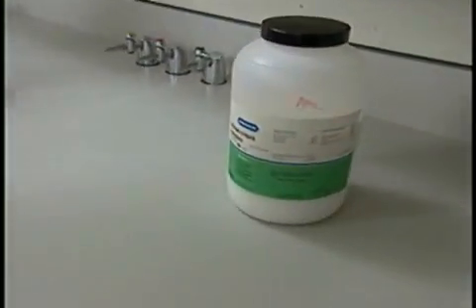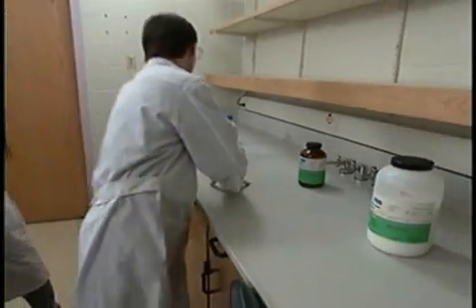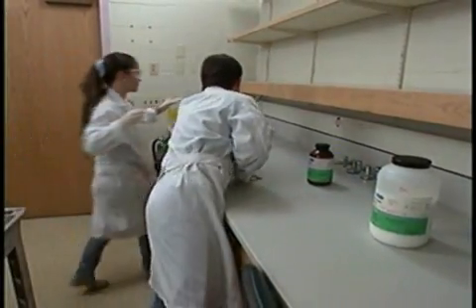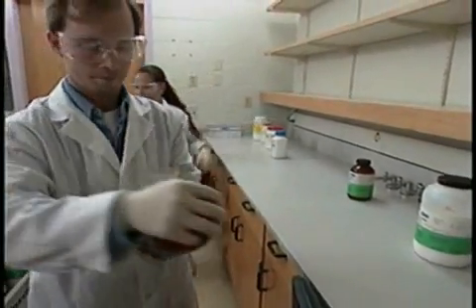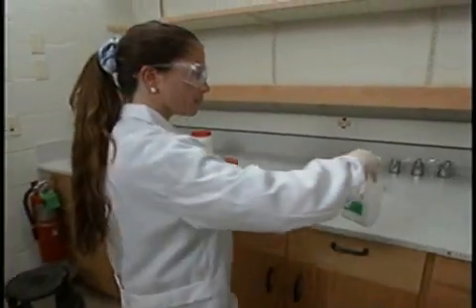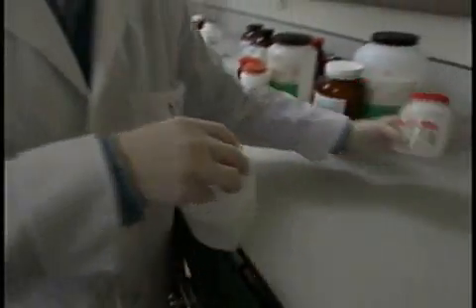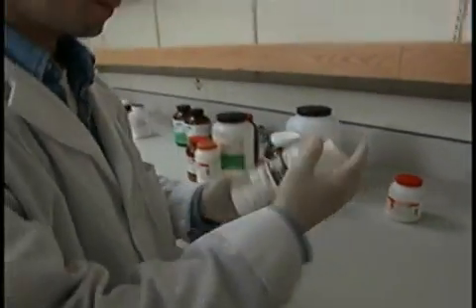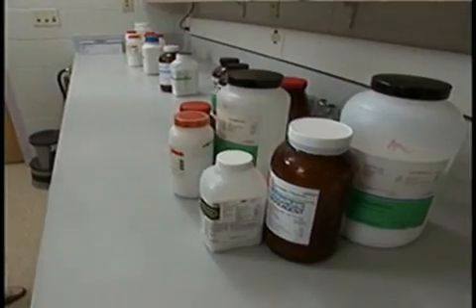The first instinct, naturally, is to arrange alphabetically. For convenience, nothing makes more sense. But of course, it's compatibility that has to take preference. This first group of materials that Mario and Lisa have brought from the old lab are dry chemicals, which can be stored together. Alphabetizing them is a good start.